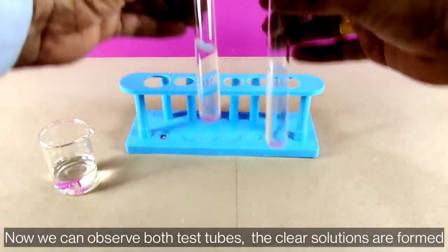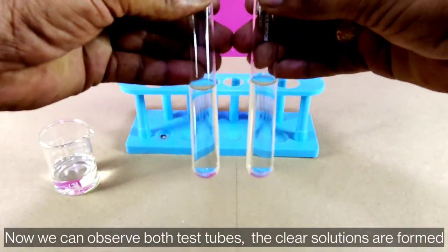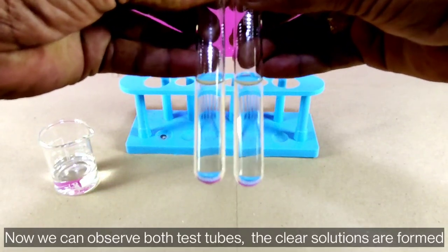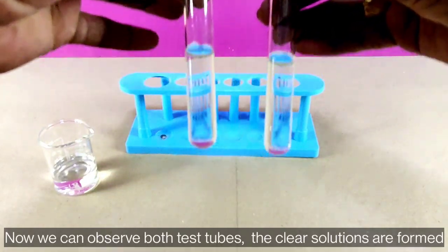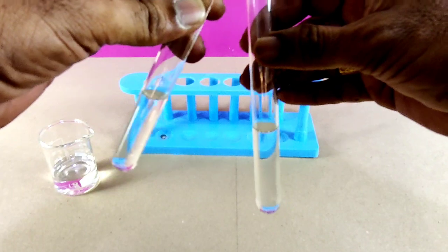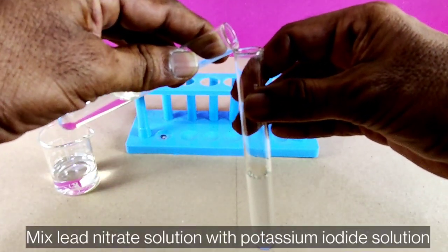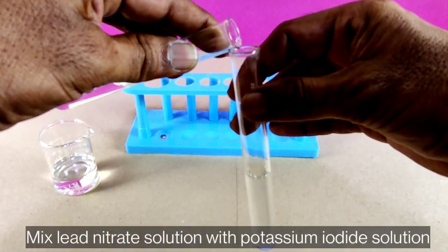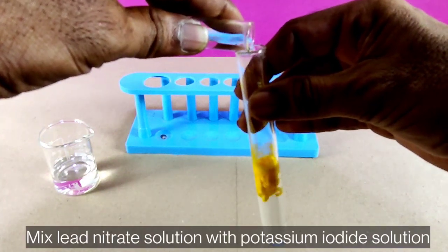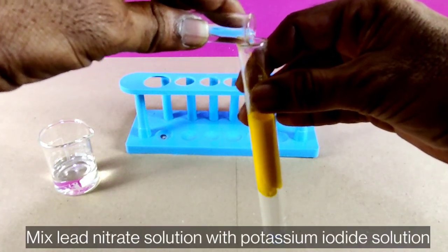Now we can observe both test tubes. After dissolving the two components, clear solutions are formed. Mix the lead nitrate solution with the potassium iodide solution.